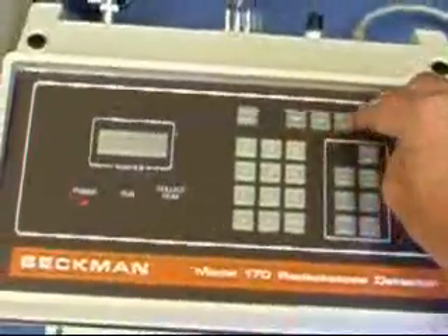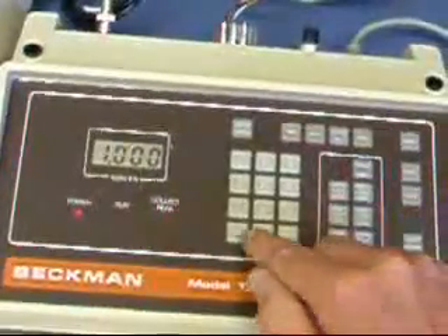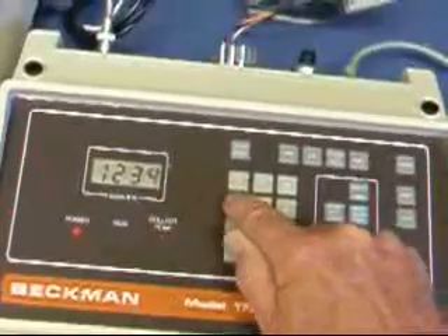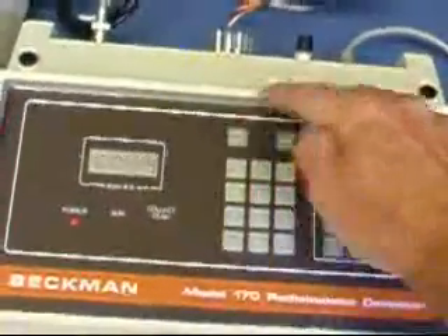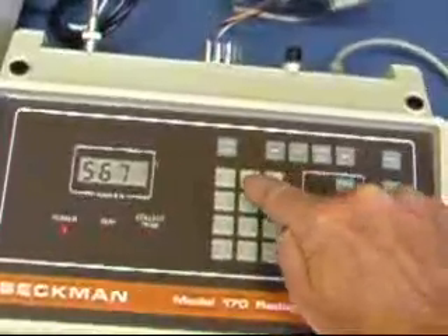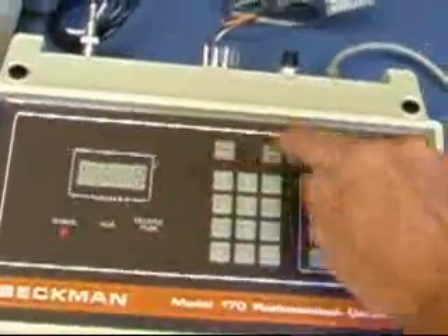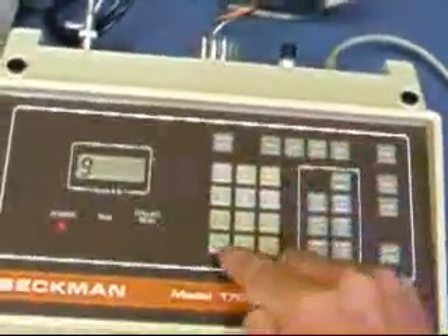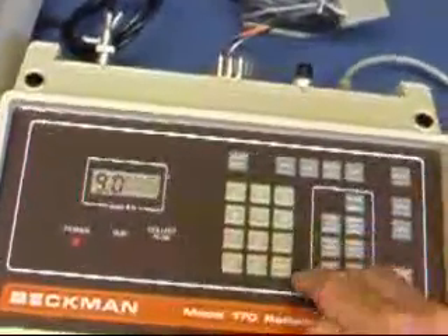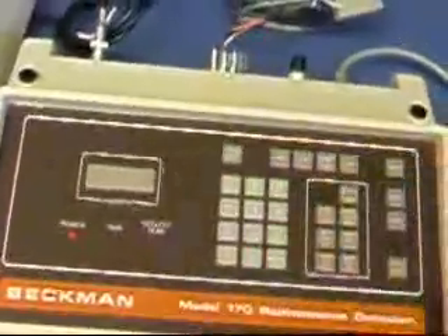Here's if we press the normalization factor and use each of the digits. The 9.0 clear entry.